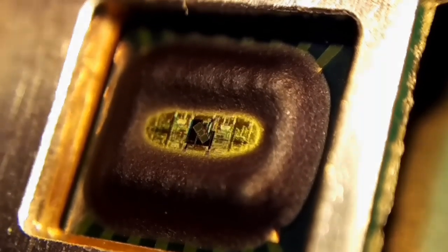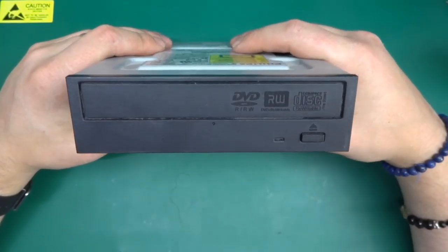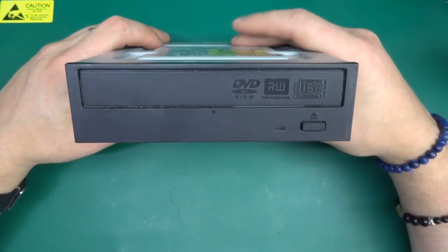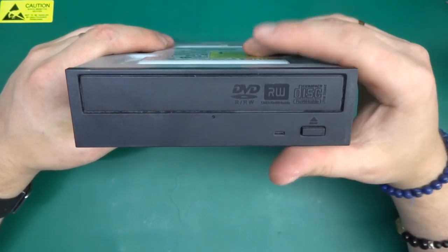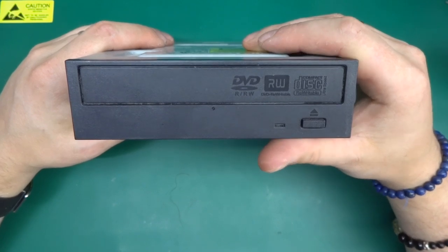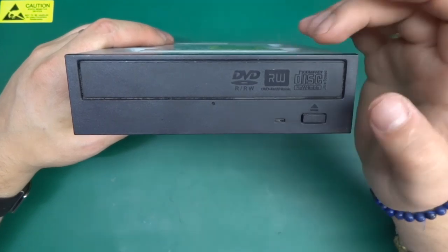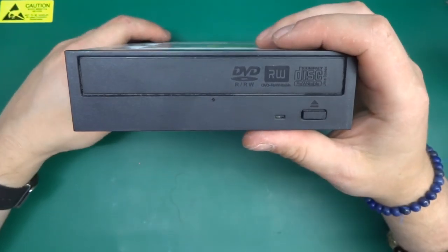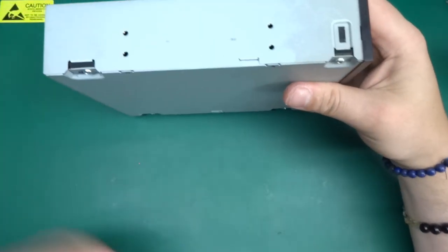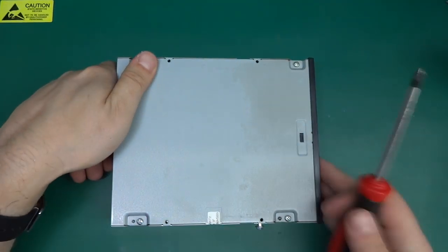So yeah, without further ado, let's get to it. So what you need is a CD-DVD drive combo. Now, it may be possible that you can get what I'm after out of a CD-ROM drive, a different type. But as far as I know, this particular lens is only in a CD DVD combo drive. So, well, at least that's what I've been getting more luck with. So yeah, what you need is an old CD-ROM drive. Let's take it apart.